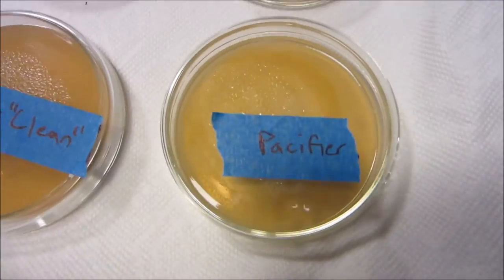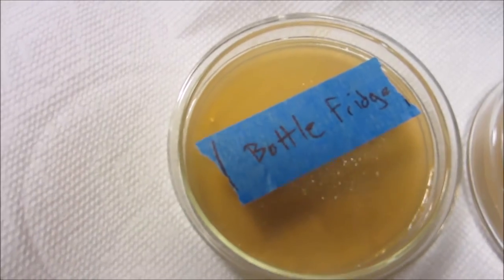Bugs, germs, all the stuff that babies aren't supposed to be exposed to. So I decided to culture a few of the most common objects that babies are exposed to, including the baby's mouth.